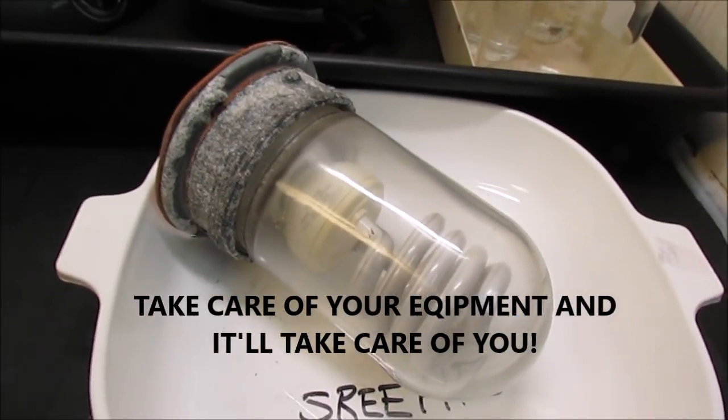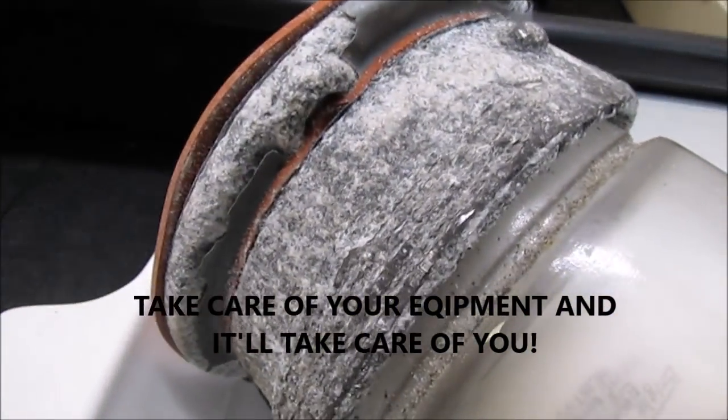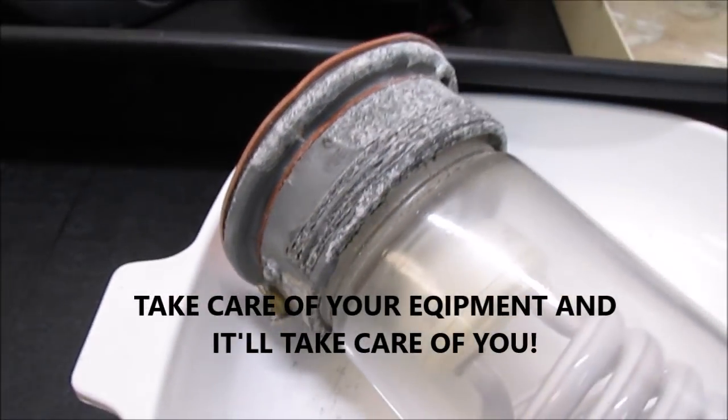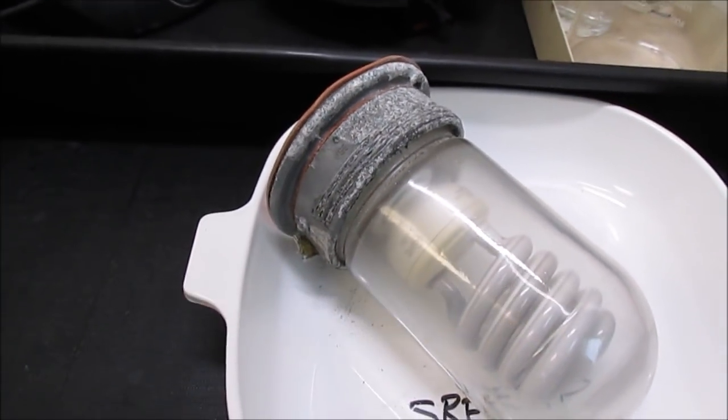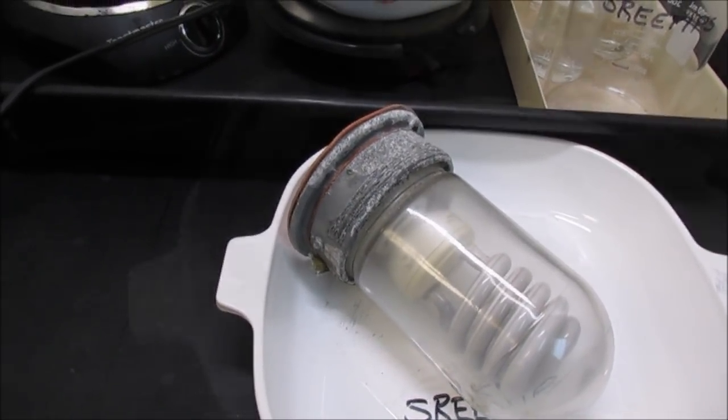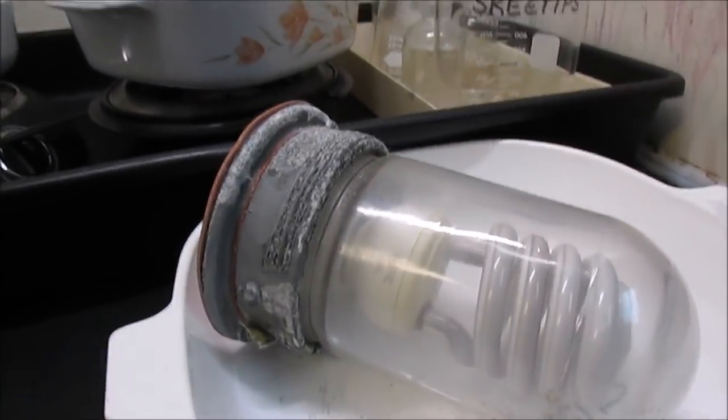I've been without a light for so long, but you can see here how the metal was flaking and falling apart. It was falling down into my work. So what I did is I modified the Fume hood to accommodate an LED light, and I'm going to show you how I did that. I'm going to go ahead and point the camera at the modification inside the Fume hood here.